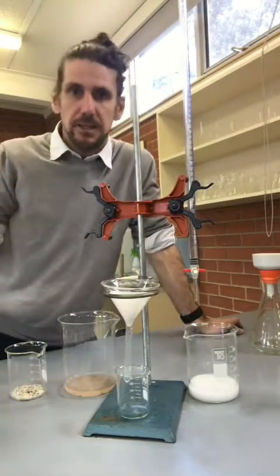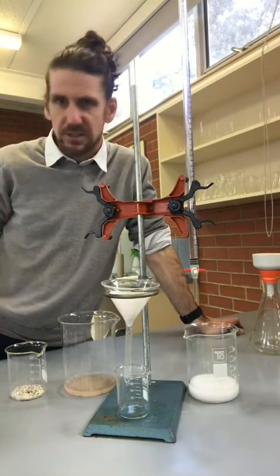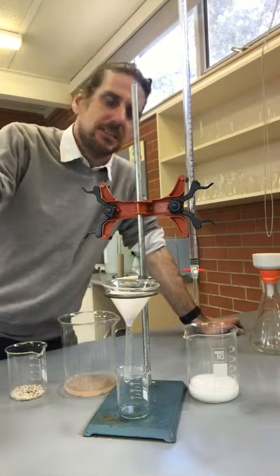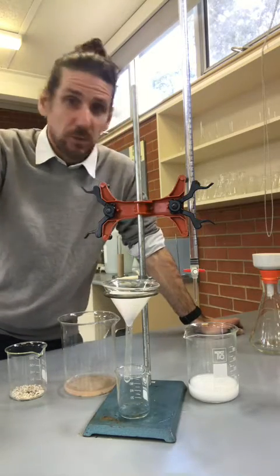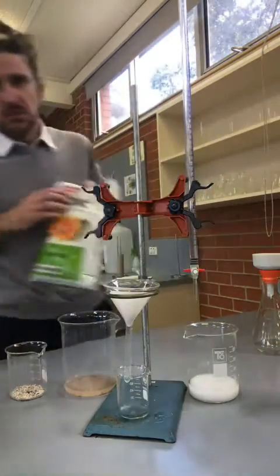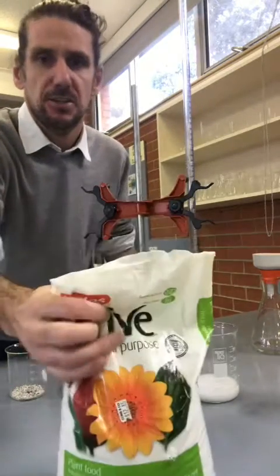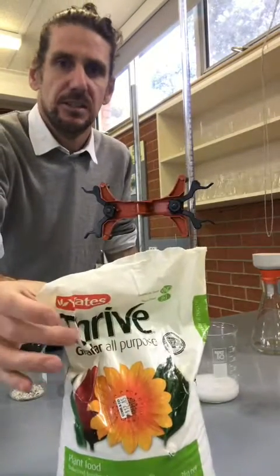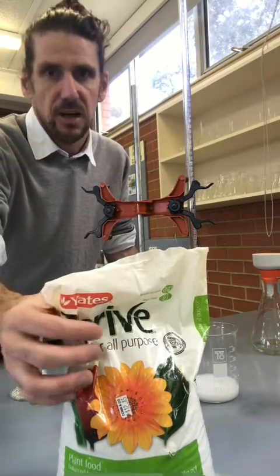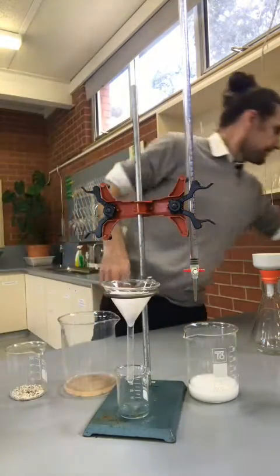In Year 11 chemistry today, what we did was a gravimetric analysis. What we wanted to do is we were using precipitation reactions to find out how much sulfate was in this stuff here, which is Thrive. It's a fertilizer, and we're looking for sulfate.